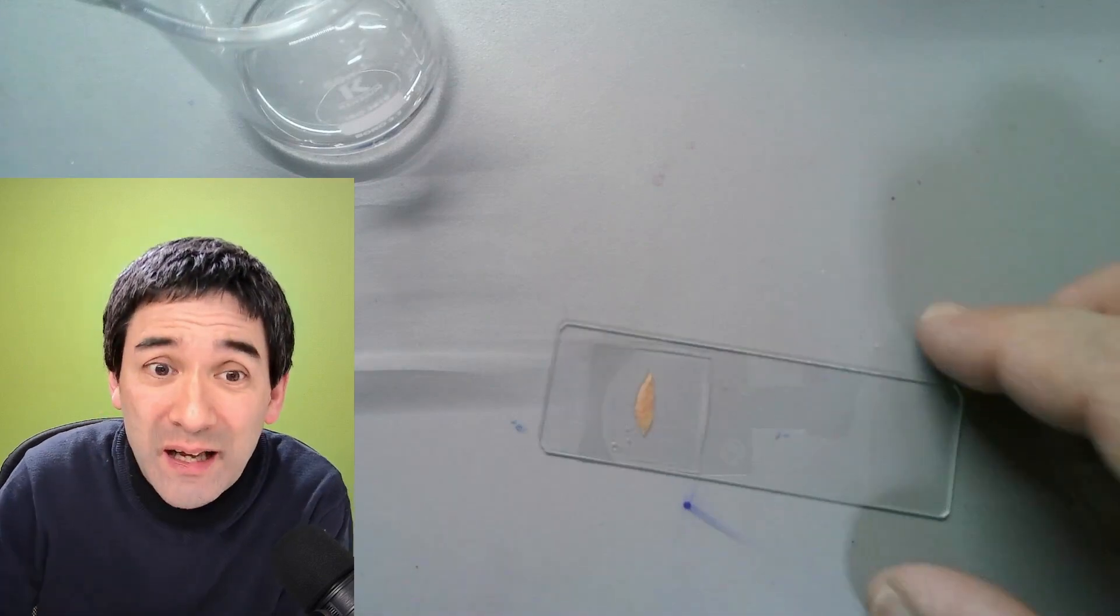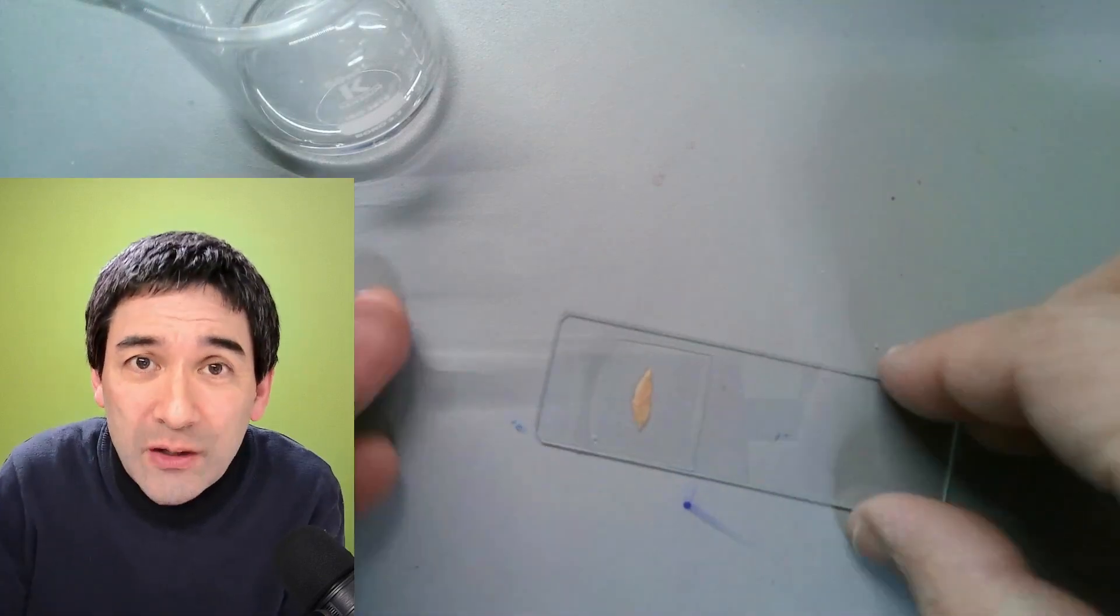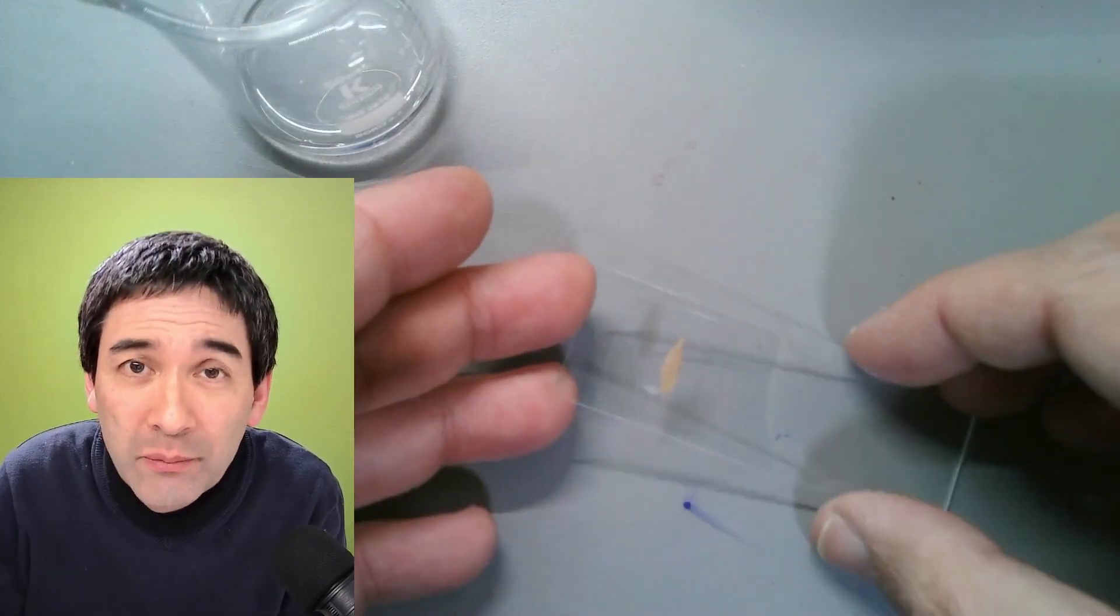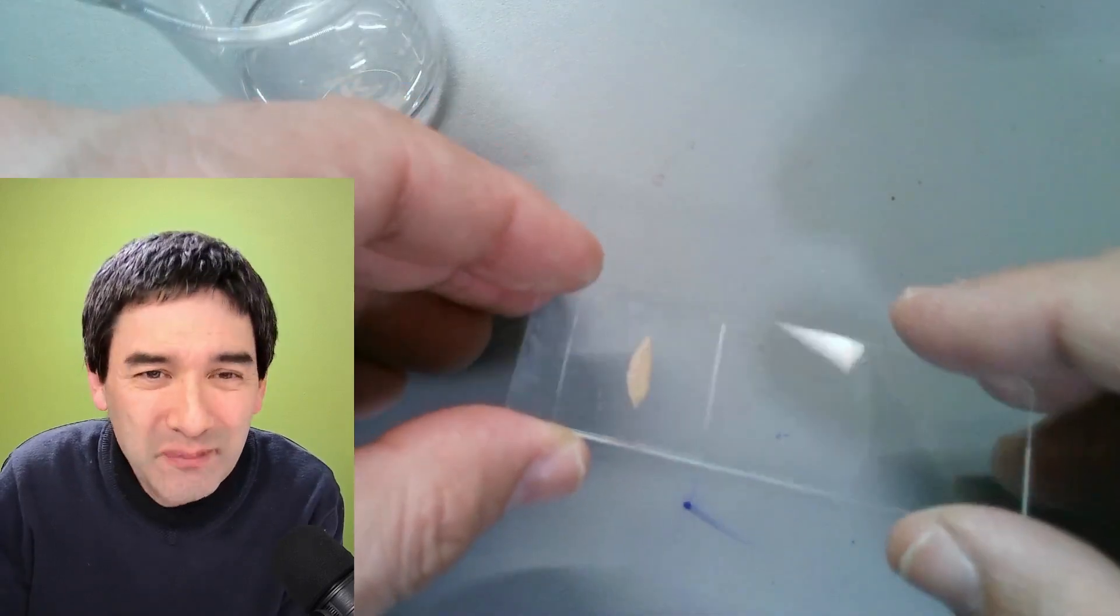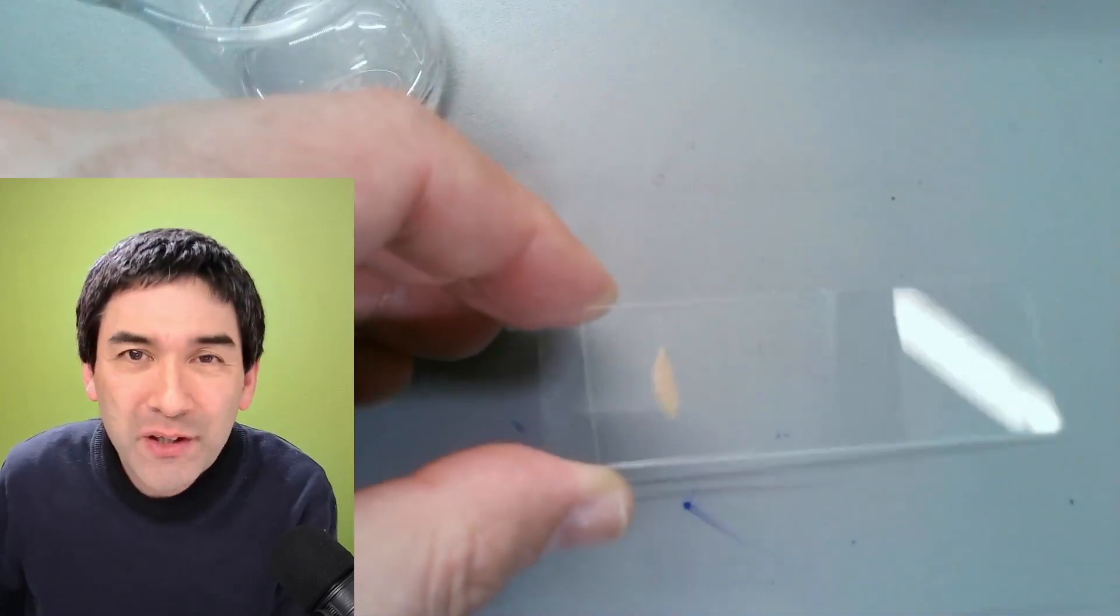That's already it and I'm going to also show you later how water would make the whole thing appear a little bit different because water is not quite as suitable. But let's put it first under the microscope.